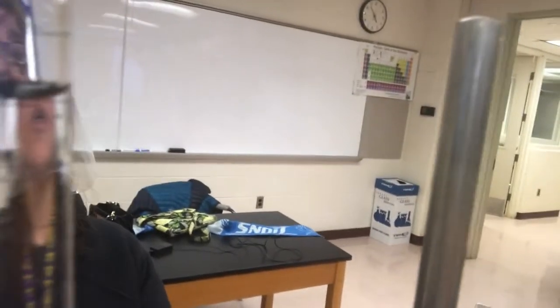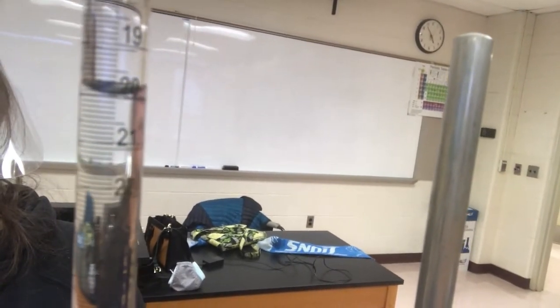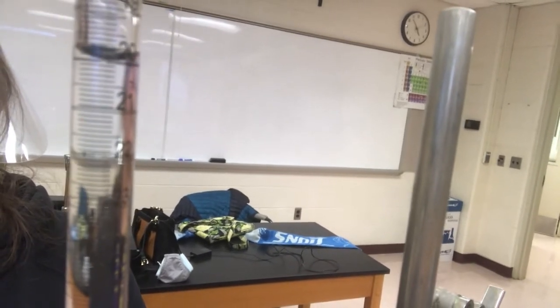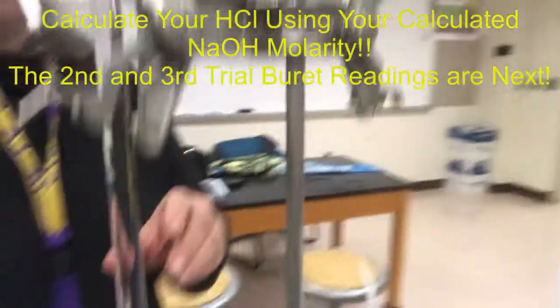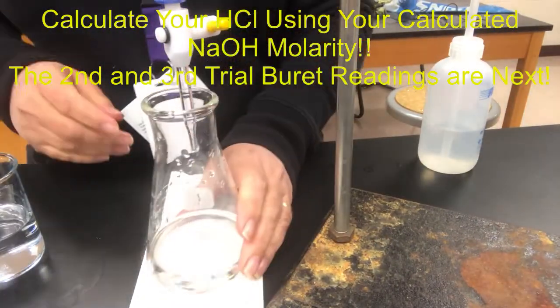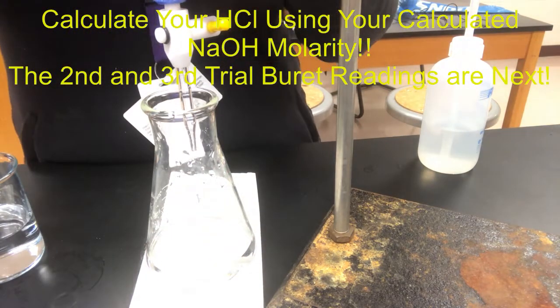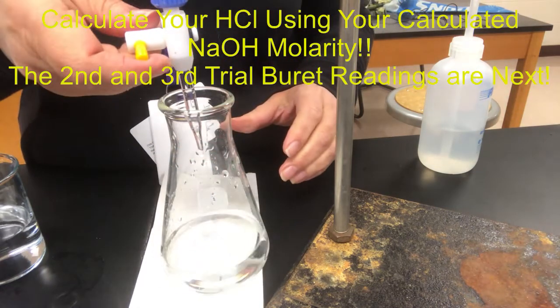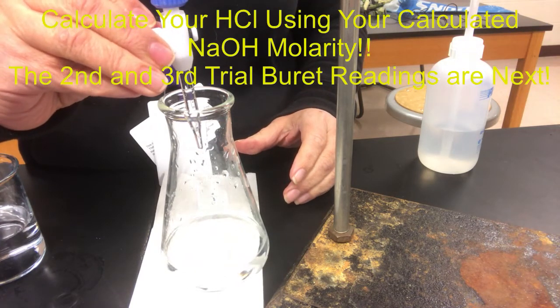So let me get out of the way and get the whiteboard back there and turn this so you can see the numbers. Okay. And I'm going to add one more drop. And if it's still pretty light, if it's faint, then we'll take one more reading. And it probably won't change by much unless I accidentally add in a whole blob full at once. But I'm going to try and be super careful. I'm going to hang a drop and then wash it in. So let's see how this goes.